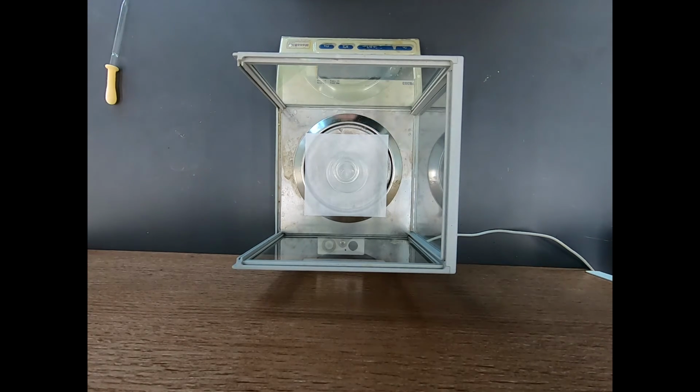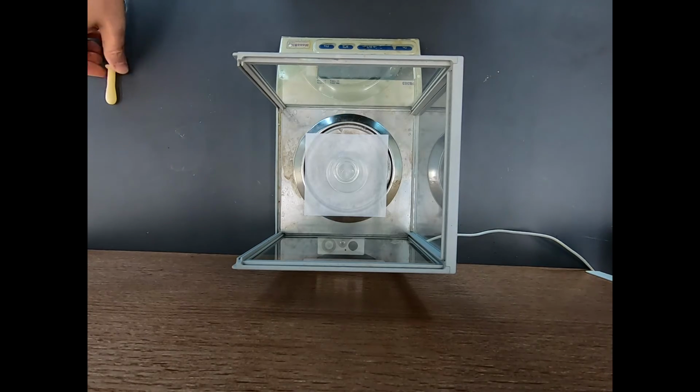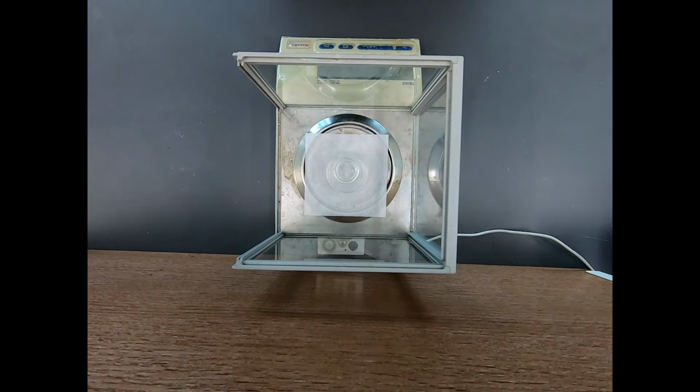Okay, 1.49 grams. Now, I'm going to be a little risky because now I'm going to try to weigh out our benzaldehyde in this same Erlenmeyer flask. Now, I just want to make sure I get enough of the benzaldehyde. A little bit of excess is fine. I want about 6 grams, so I'll probably aim for 6.1, 6.2, 6.3.